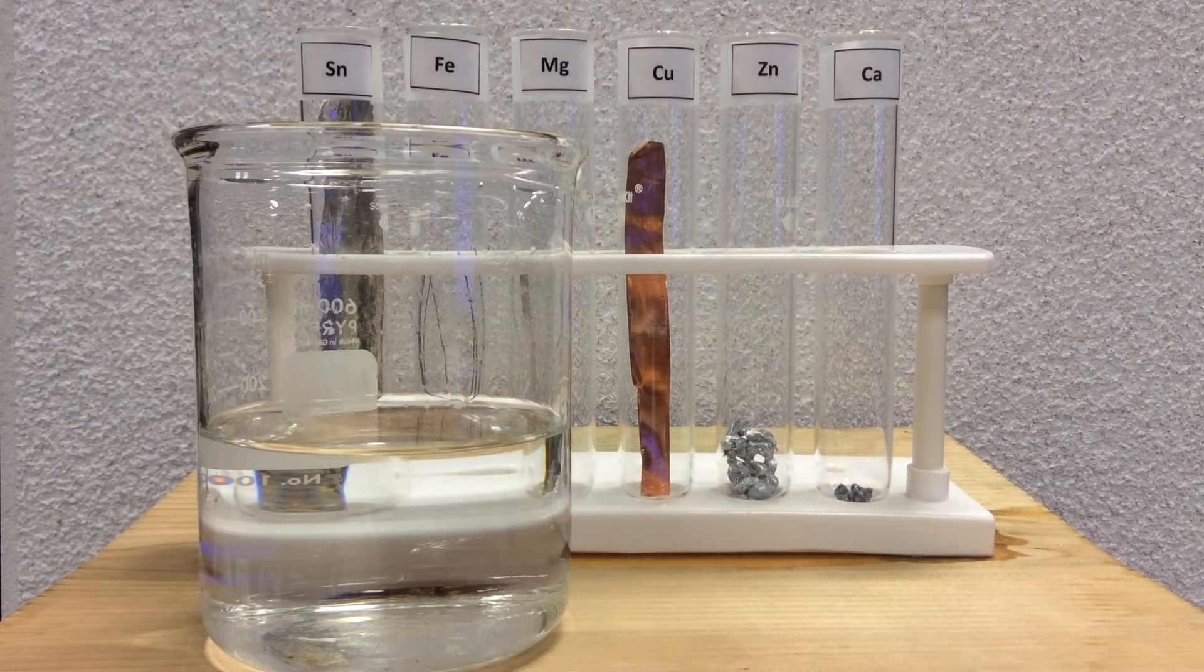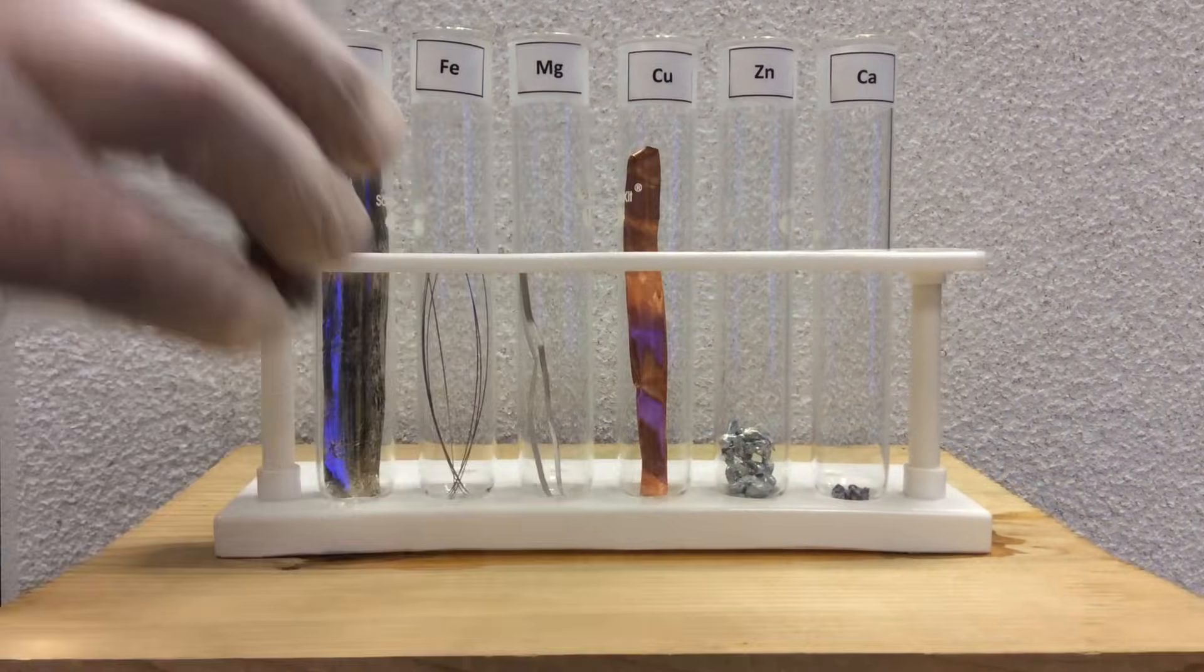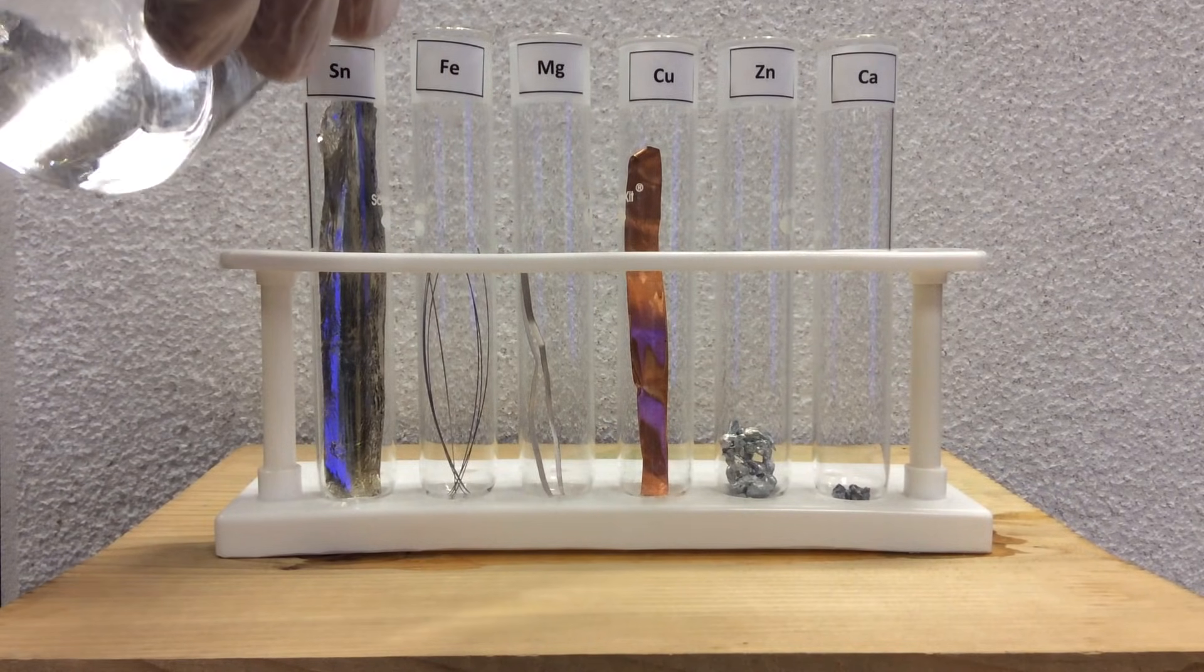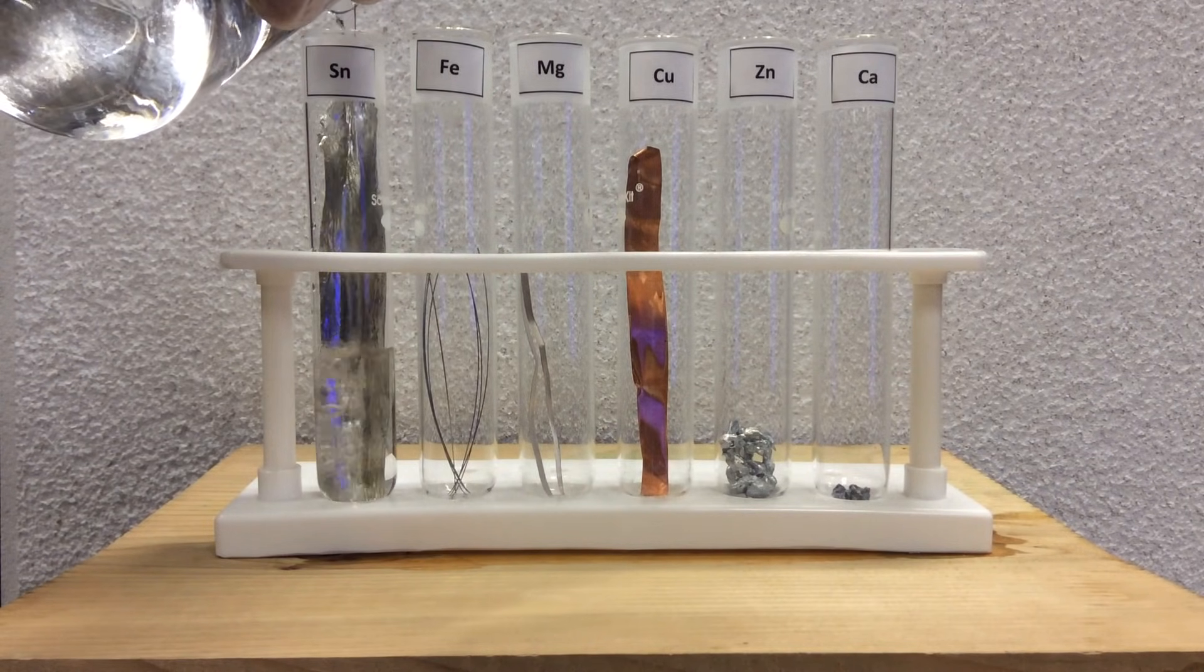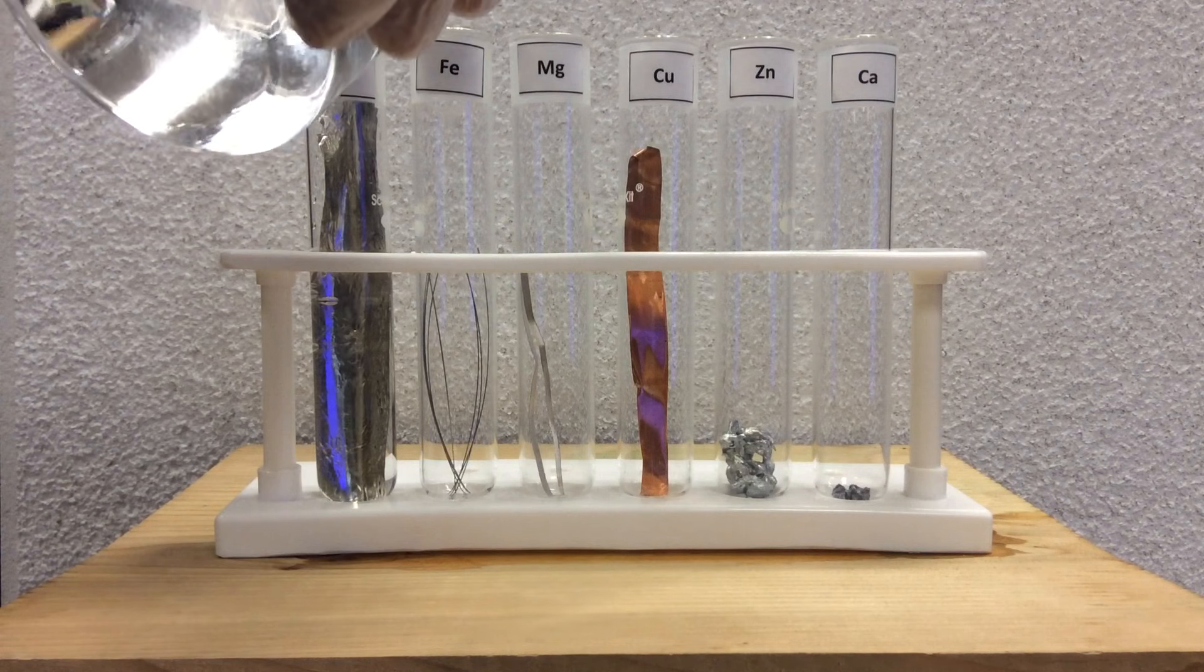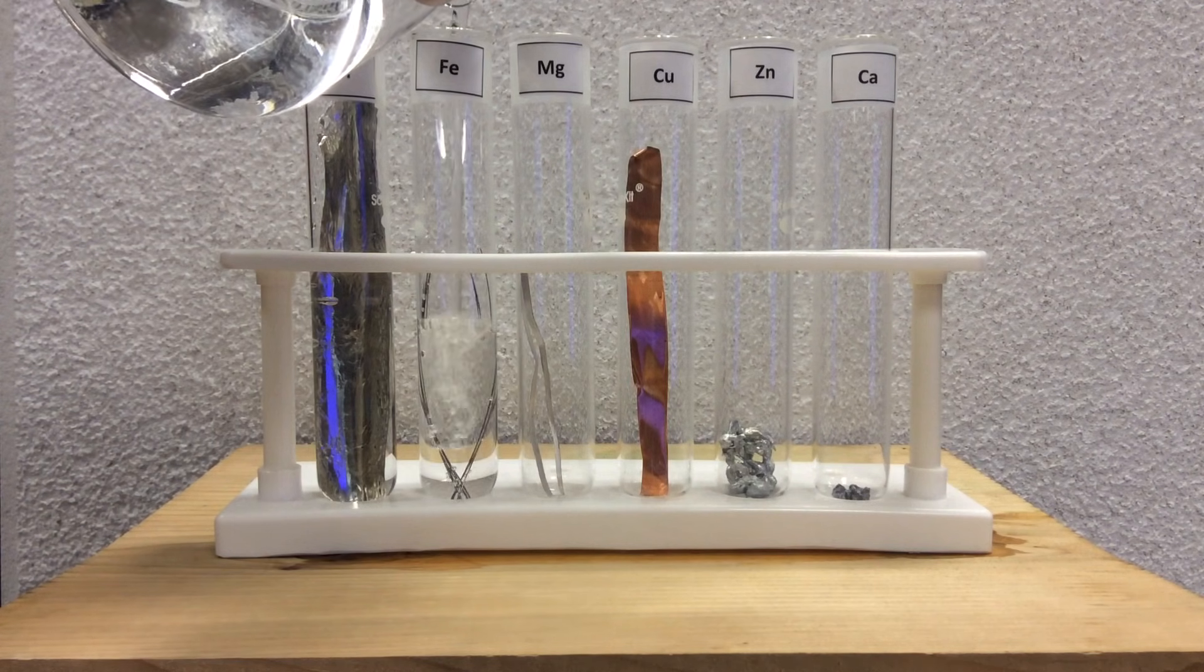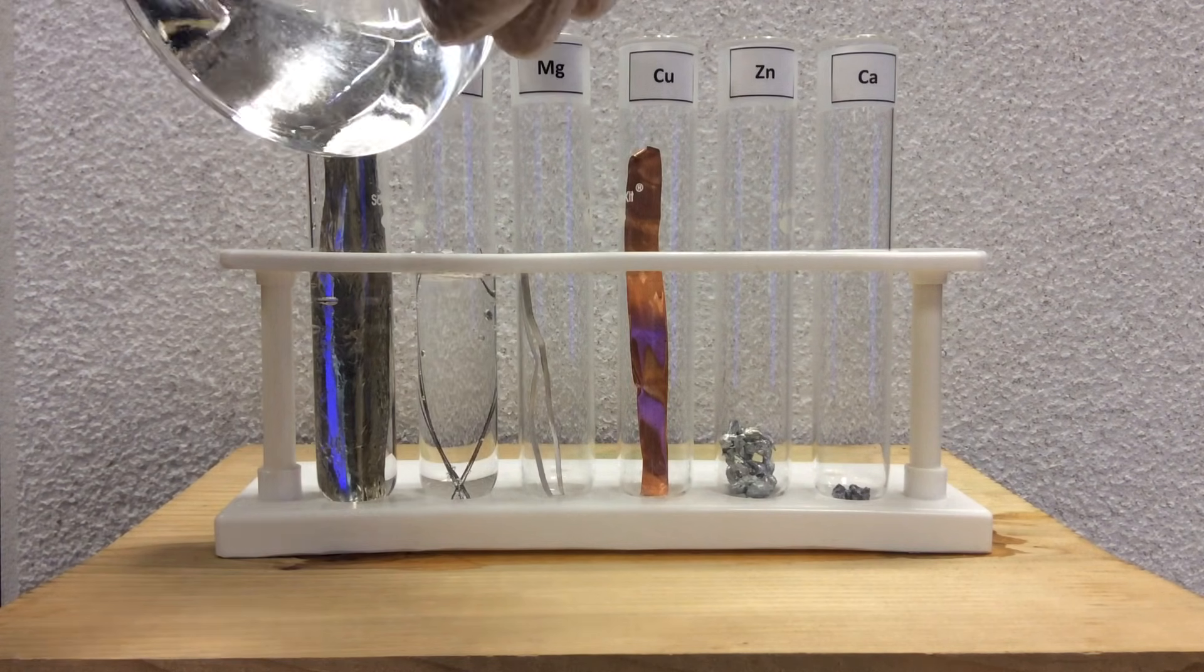In any case, that being said, we're going to pour this water, which has phenolphthalein, into the solutions. Same metals now. We're doing, again, the half reactions are essentially the same because we're trying to reduce the proton from the water.